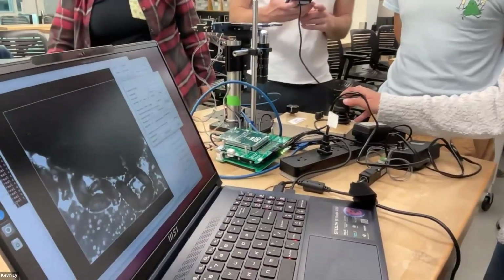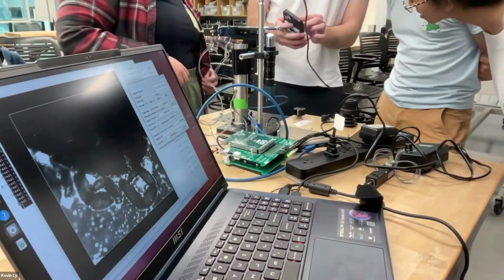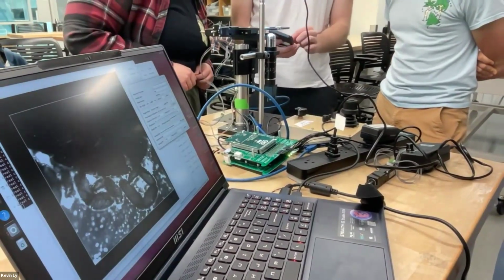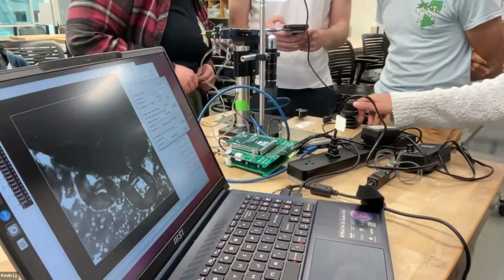You can see that the helix, like the drive he was talking about, is moving. Oh, there you go. You go left and right. I think you can literally see the bottom curve at the back of it. It makes sense to me. Does it say whether, well, we can Google it, I suppose, whether males take blood meals?